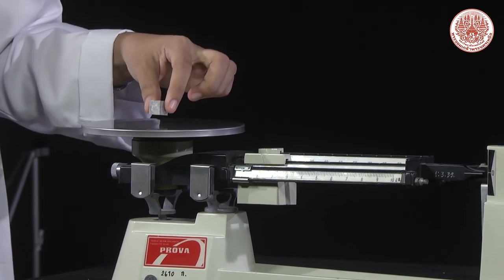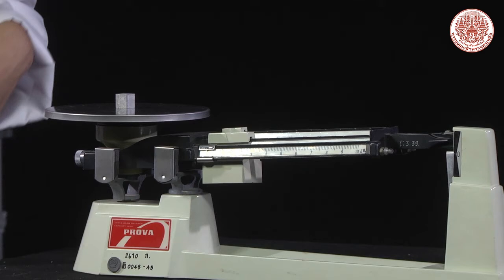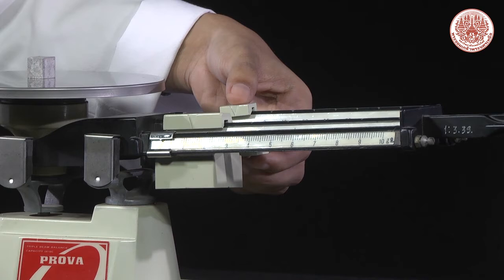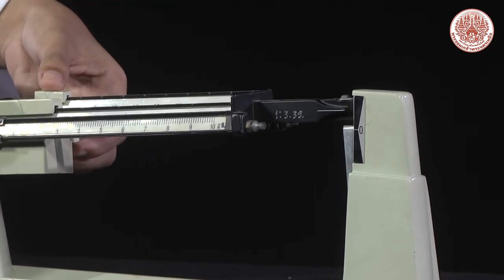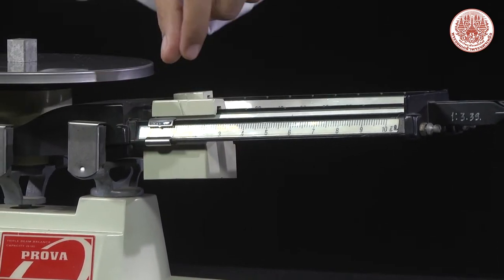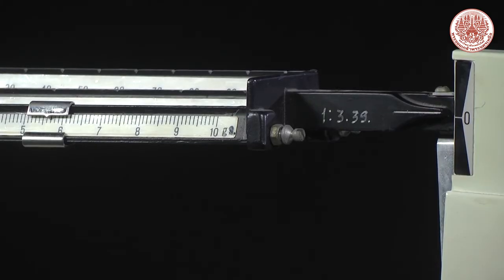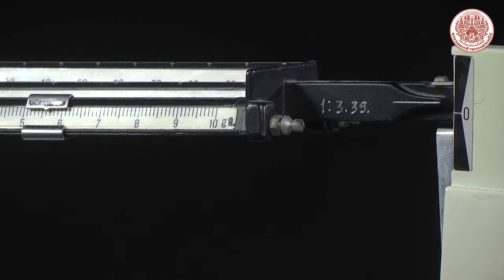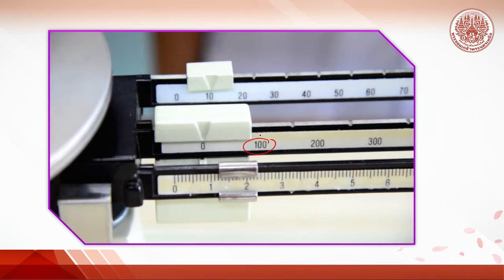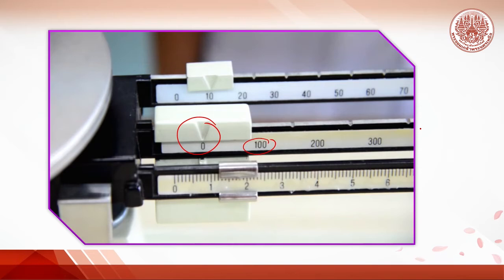Place the aluminum cube on the pan. The balance point will move above the zero mark. Slide the weights and adjust to get the balance point back to zero. If the balance point is below the zero mark, slide one weight back one notch, then move the smaller weight right until you reach the zero mark. The 100-gram weight is at zero, meaning the cube weighs less than 100 grams.